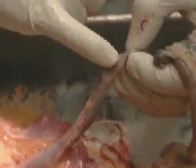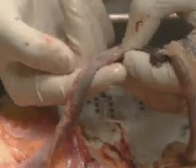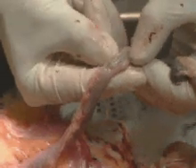As we proceed down the intestine we encounter the large intestine. The components of the large intestine are the paired sacs of the ceca, which can be green or brown. These are joined at this point where we have the very distal portions of the small intestine. These two bulges are the cecal tonsils, which are normal lymphoid patches, here and here. And then this is the remaining colon or large intestine.